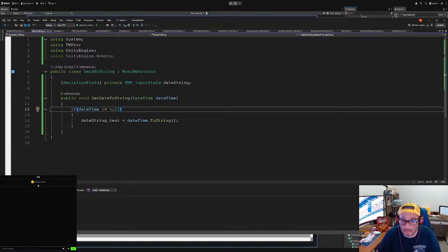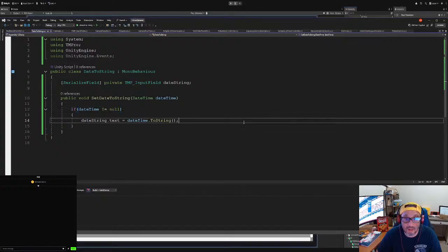Right here. After I did all that, calendar, events, and we want to change. Come on, come on. What was it? Not drop down. What was it? Or input field. And then we want to set data string. There we go. Okay. All right. And then we want to make sure that this is an interactable so we don't mess things up. No, not really. Okay. And so, let's see. It should work now.